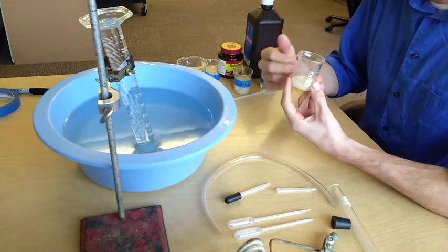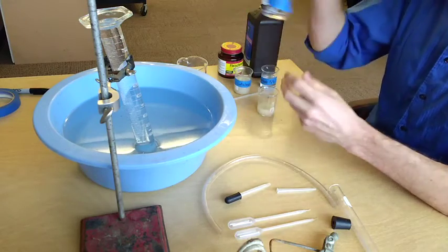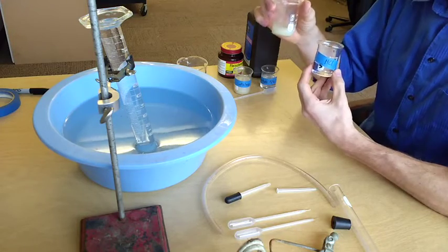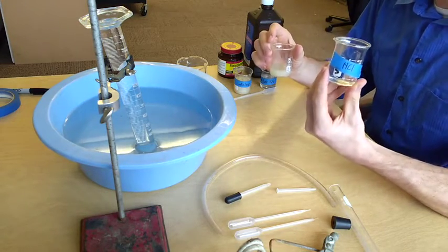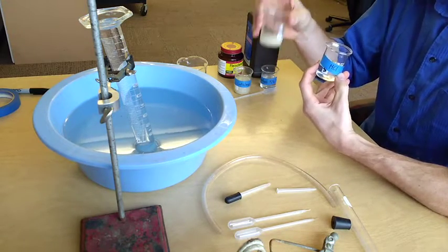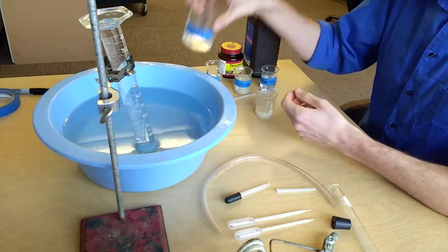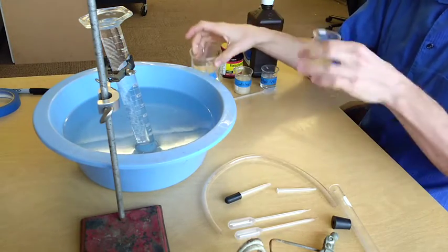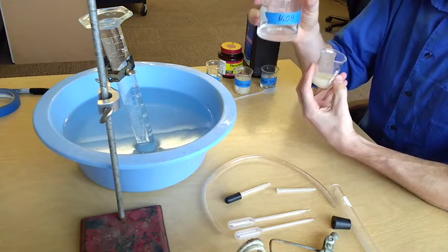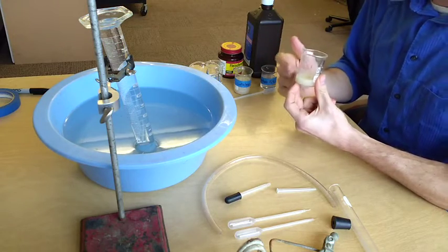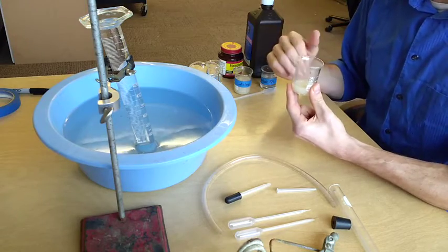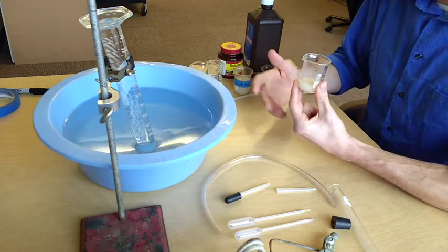Same thing if I wanted to measure pH, I would add something like hydrochloric acid to lower the pH, and then measure the pH of this, paying attention to the fact that if I add a milliliter of this hydrochloric acid, I am diluting the enzyme. Or if I wanted to raise the pH, I could add sodium hydroxide to my environmental mixture, also knowing that any addition would dilute the 100% mixture here. Having it diluted is fine, you'll just need to keep track of that and be able to report it in your lab write-up.